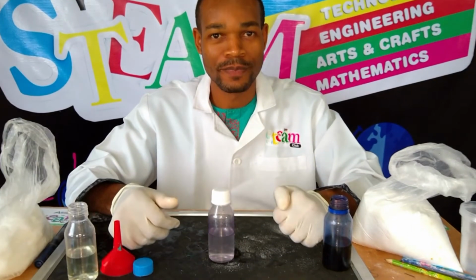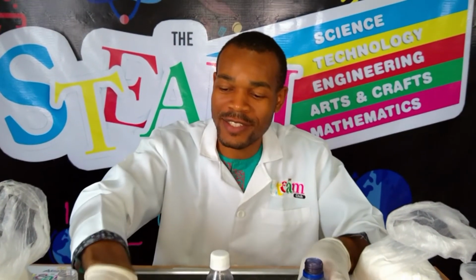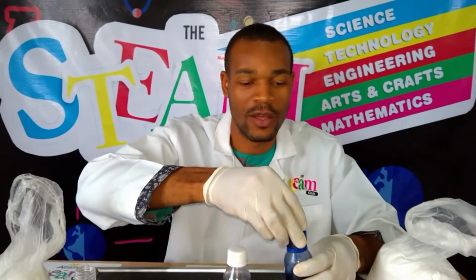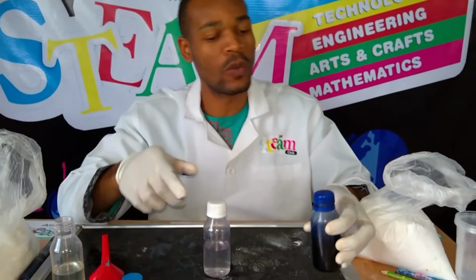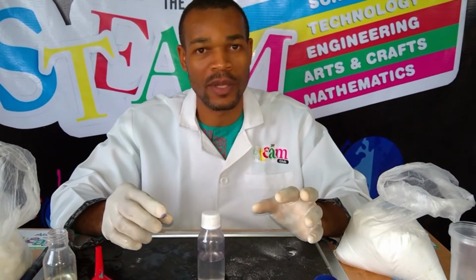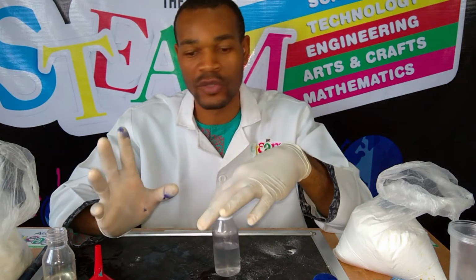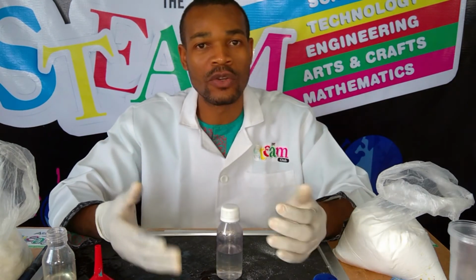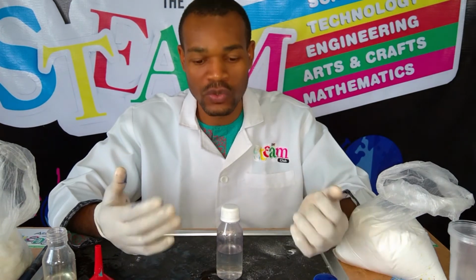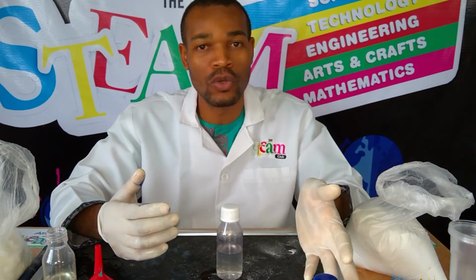Awesome, right? So great. So the question is, what is actually happening in this bottle? Because the point of chemistry is to be able to explain physical phenomena. Anything that you see that happens physically has an explanation. So the point is, what actually happened in this bottle? Very simple. Now, I showed you earlier on some chemicals that we used. I talked about the glucose, I talked about the potassium hydroxide and the methylene blue.